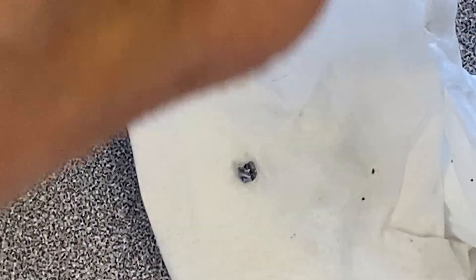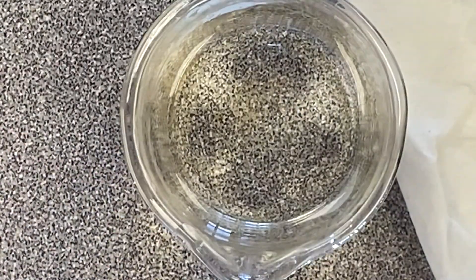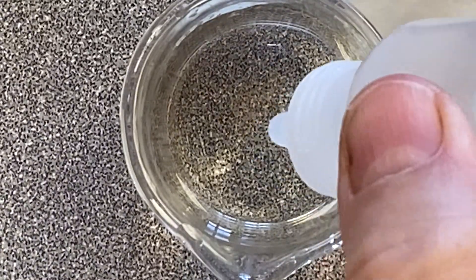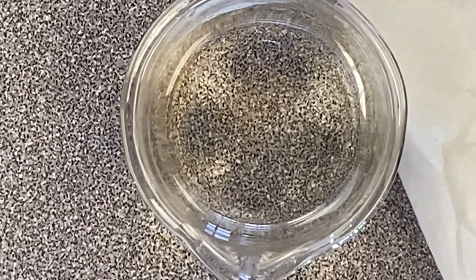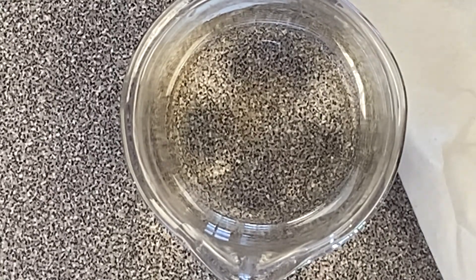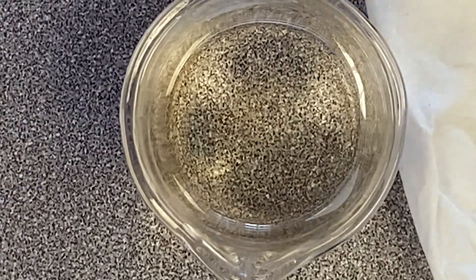I'll put the phenolphthalein — an indicator of a base — in the water to start with. You'll see that the color is clear, so it is not a base. When I put the potassium in the water, the potassium will pull apart the water molecule. Hydrogen gas will be released, and it might even get so hot that it lights itself on fire without me needing the stick.